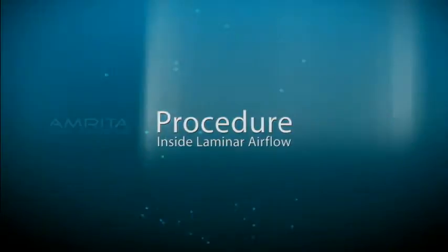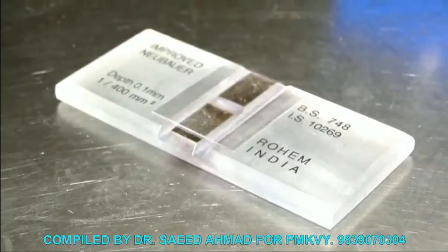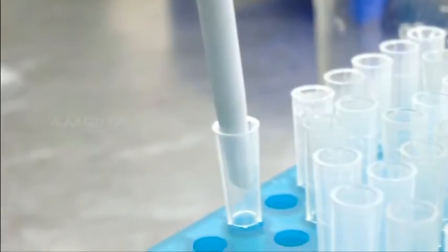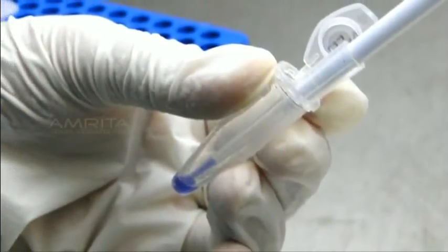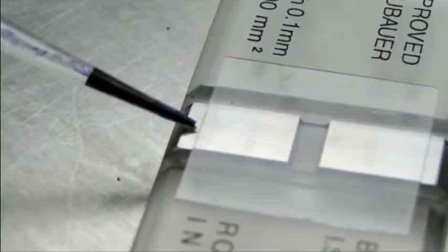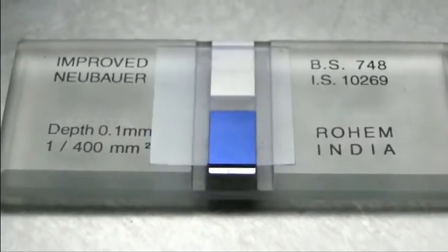Now the procedure inside the laminar air flow. Take the hemocytometer and place it inside the laminar air flow. Set the scale of micro pipette to 10 µL and insert a new micro pipette tip. Take the vial containing trypan blue cell suspension, open it, and mix the suspension with the micro pipette. Take 10 µL of the cell suspension and slowly transfer it to the hemocytometer by carefully touching the edge of the cover slip with the pipette tip, allowing the chamber to fill by capillary action.